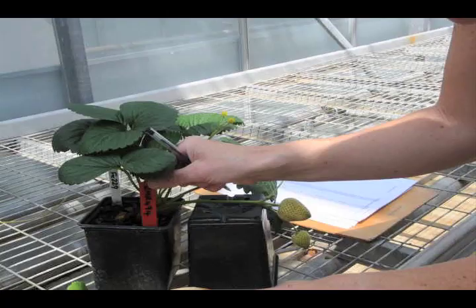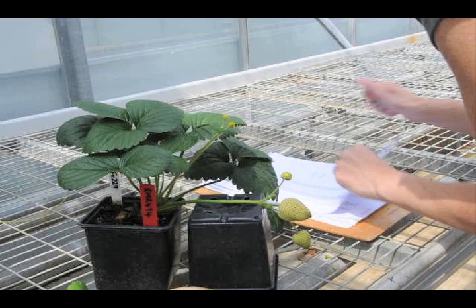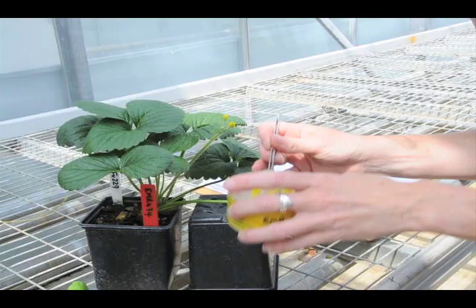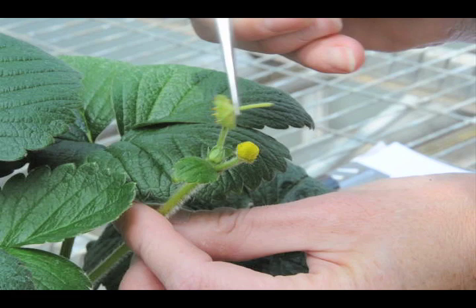The next stage is to manually pollinate the chosen plant. The chosen plant is carefully checked off against a list of proposed crossings to be made. This controlled manual pollination can be done in two different ways. Here we see the de-petalled flower being rubbed against the female receptacle of the chosen plant to achieve thorough and even pollination.